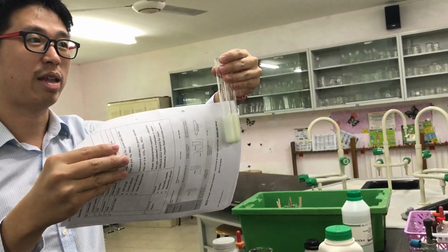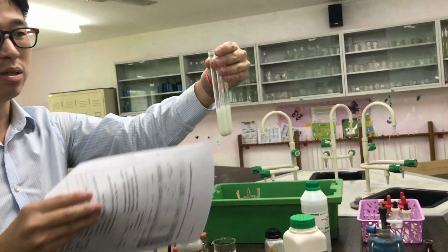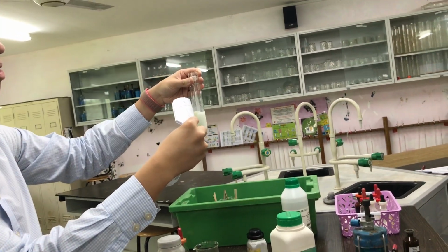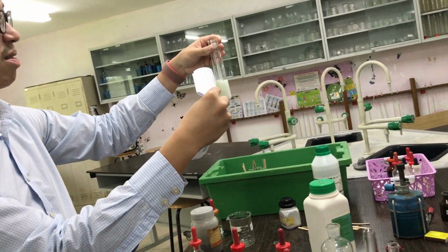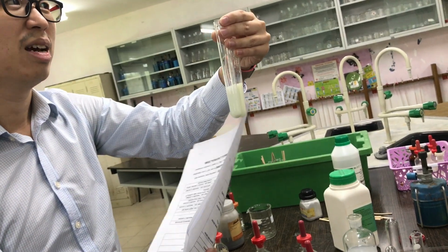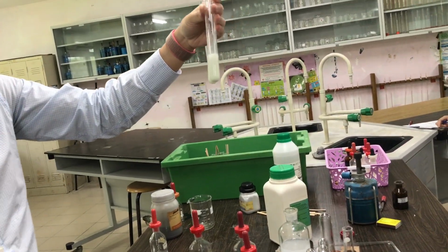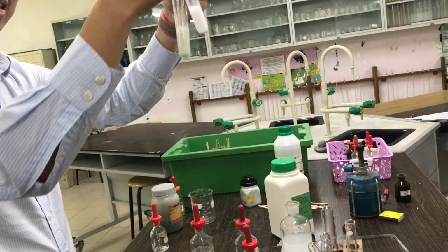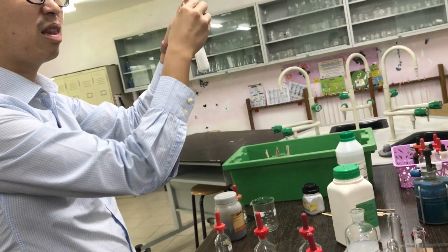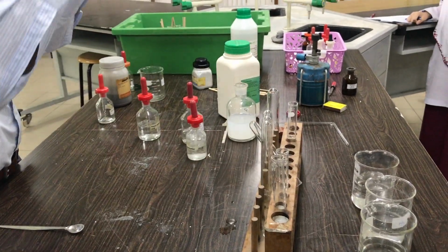One is more yellowy than the other, right? Yeah, okay. But like this is quite hard to tell the difference, but like this is much better, okay? Which one is more yellow? Right or left? Right hand side. The one which is more yellow is the test for iodide. The one that gives you yellow precipitate, and then the other one which is more cream. So it's not white because white, cream, yellow. Precipitate, test for chloride, test for bromide, test for iodide.